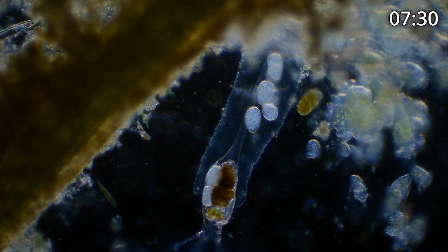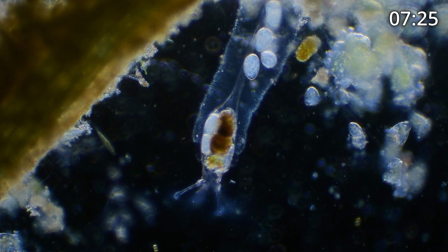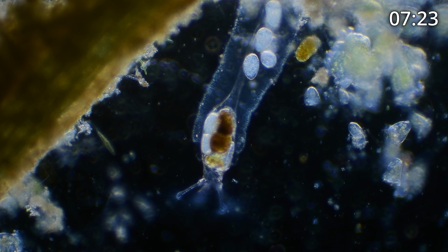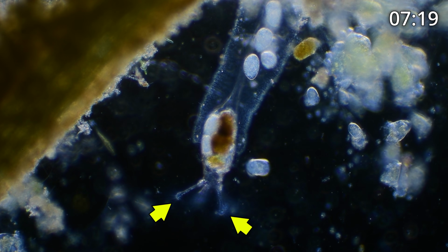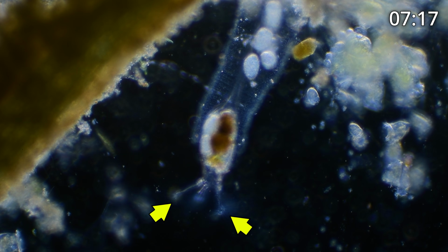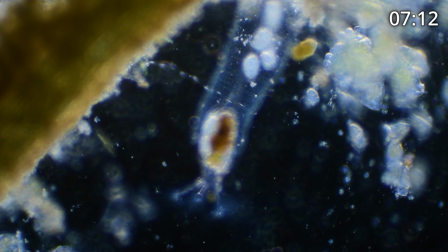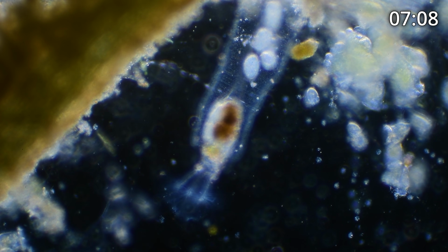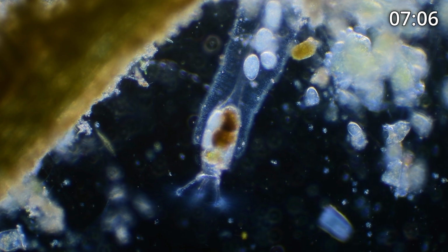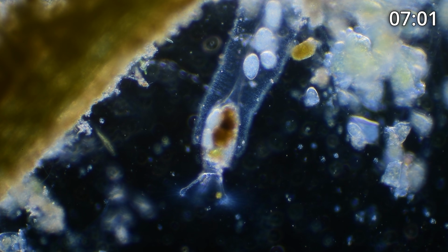I'm going to zoom in a little bit, and you'll see it's upside down, facing downward. You see these, it looks like 4, but it may be 5 lobes in blue down at the bottom of the screen. And there are hairs attached. These are cilia. And these cilia are retracted, and now it's coming back up. But these cilia slowly vibrate very, very subtly in the water.